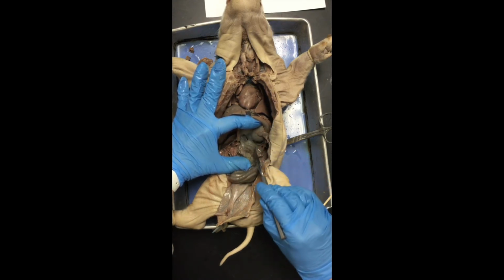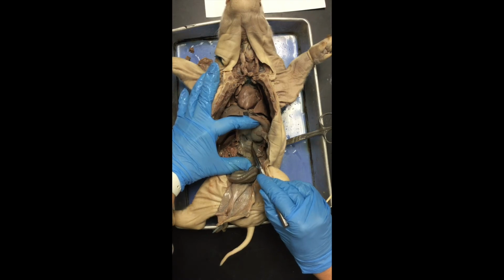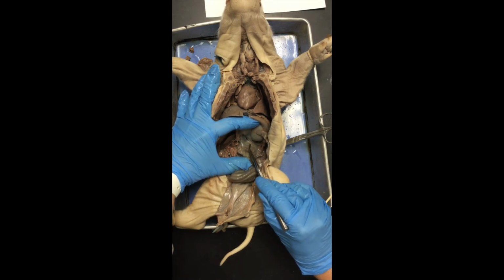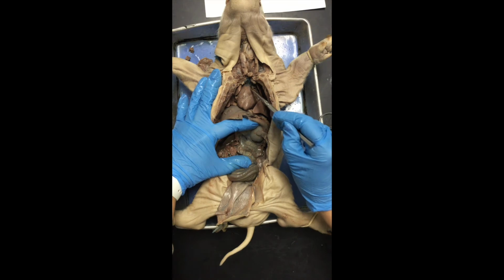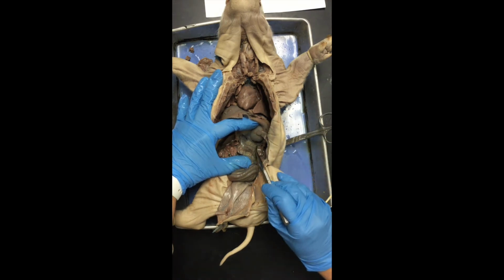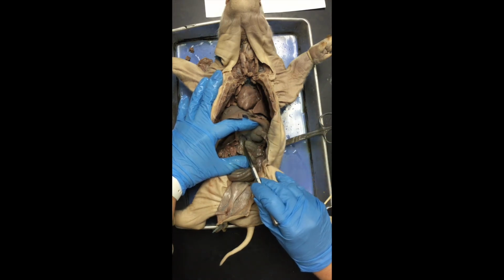So the pancreas is this gristly-like structure right here. Okay? It kind of has the same texture to it that the thymus gland did up here in the neck, and that thoracic thymus had on top of the heart. That's because the pancreas is a gland, so it's going to look kind of rough and bumpy. It's actually really delicate, though.